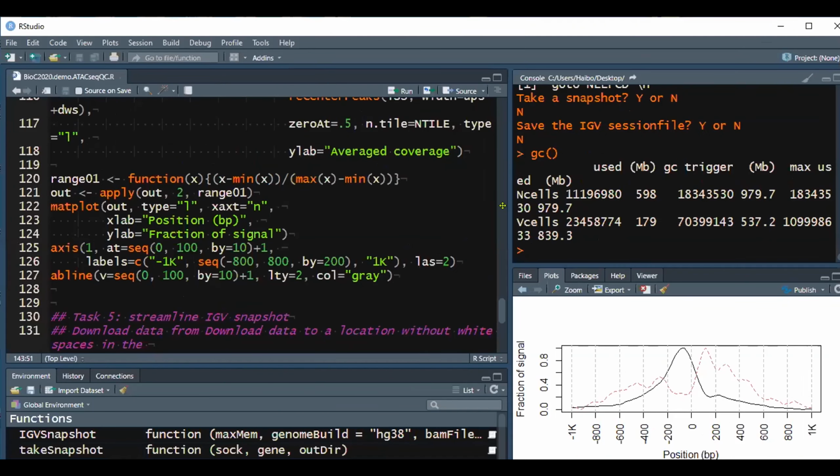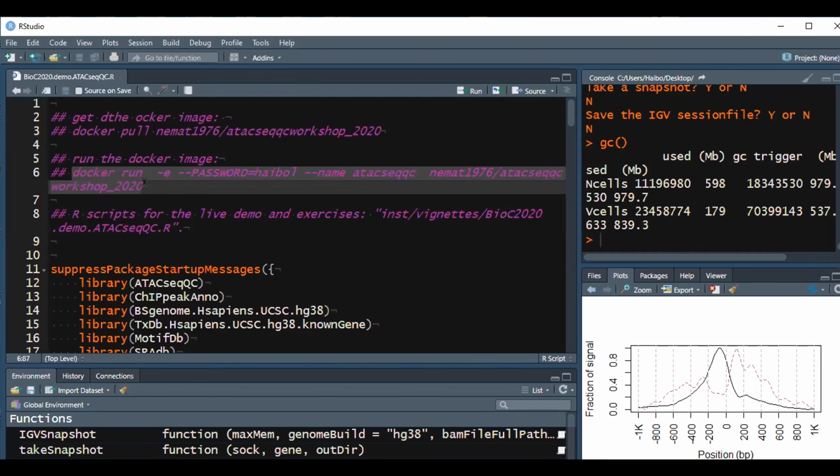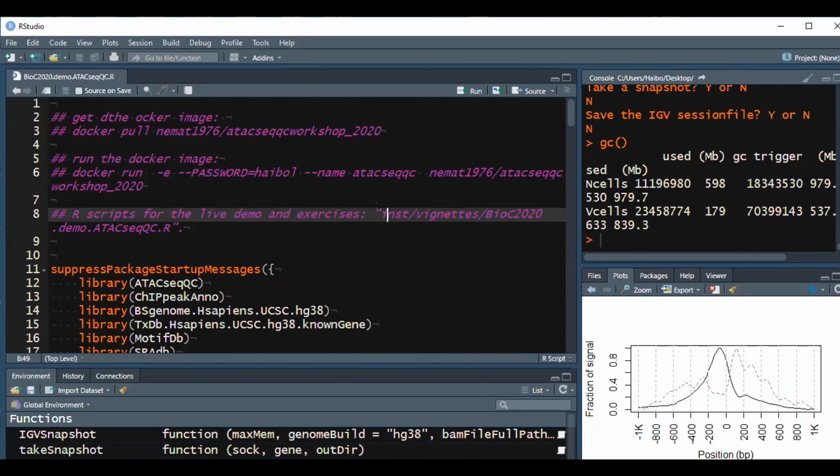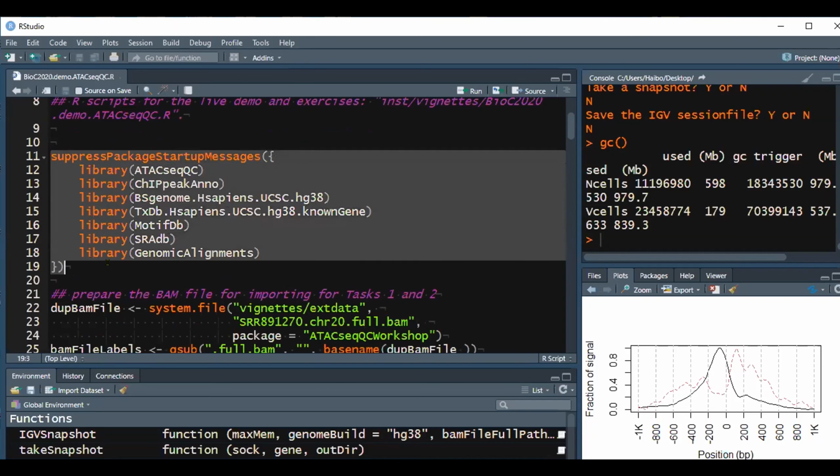I'm not sure whether you have downloaded the Docker image for this workshop. If you have downloaded the Docker image, you can run it like this: docker run, -e to set a password, then set a short name, then the Docker image name. After starting that, you can find the R script for the live demo in the ATACseqQC workshop package in this folder. First, you can load in the packages.